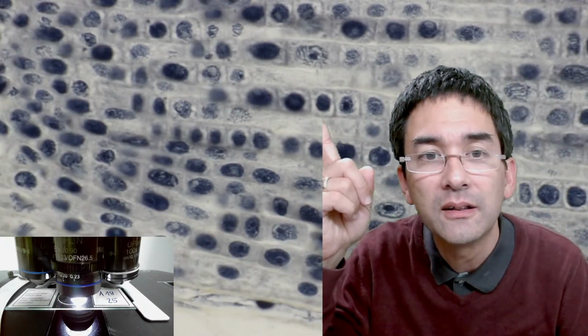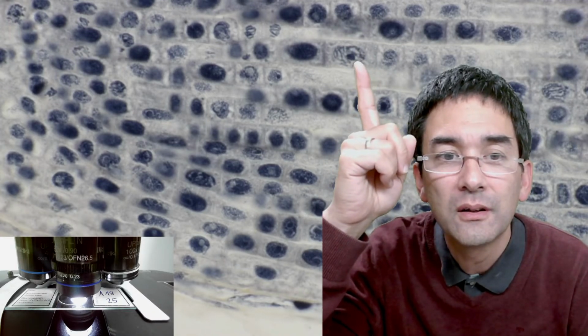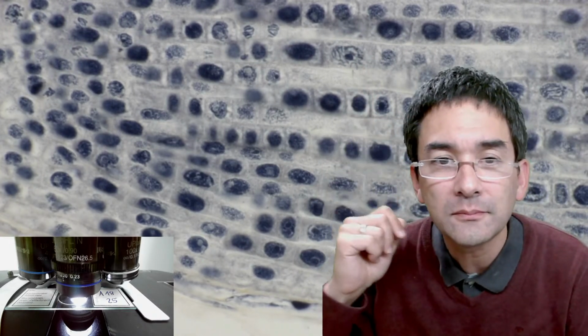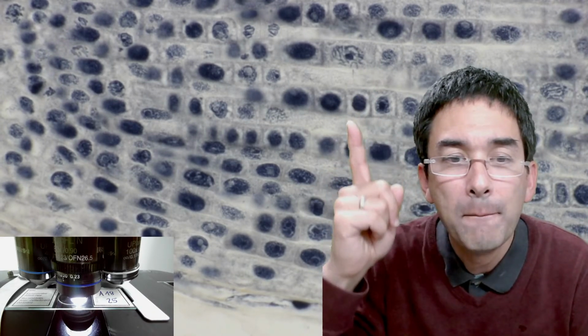As a matter of fact, when you go through a slide like this, you're going to see that the majority of the cells are in interphase, and then quite a few of them are in prophase. Here at the top, look at this one here. You see this? Typical prophase. All of those tiny lines here are the chromosomes. So interphase, those are the dark purple ones, and prophase. Metaphase, you have those where the chromosome arms point outwards.